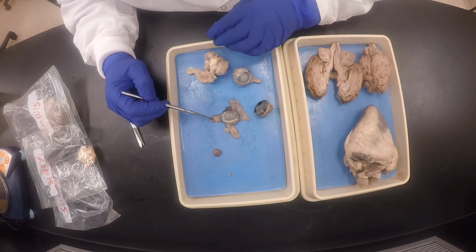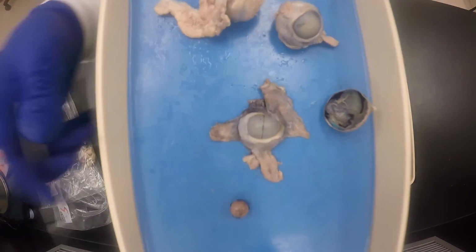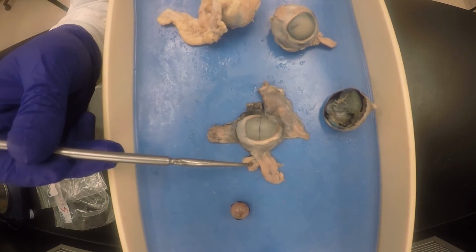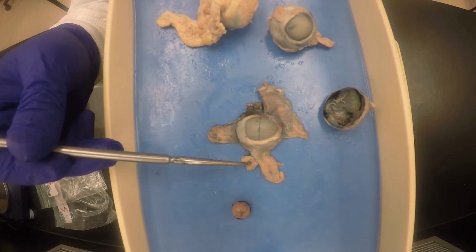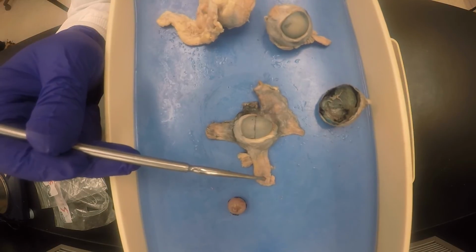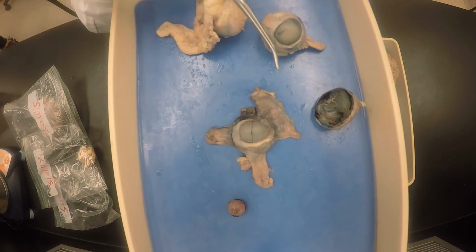So this will be the medial rectus, and this is the superior oblique. The long side with two muscles is the superior side, so superior oblique and superior rectus. And then the short side with two muscles is the lateral side.